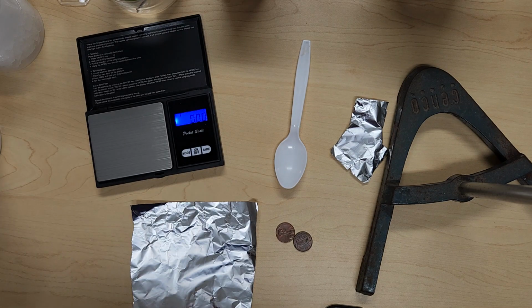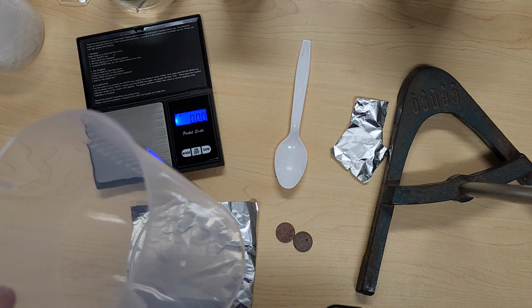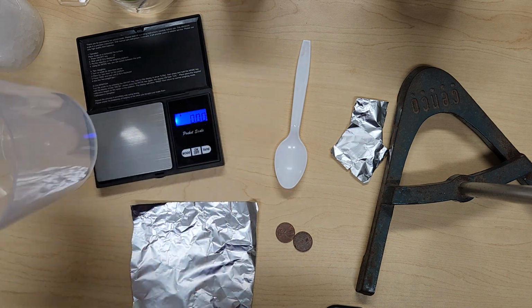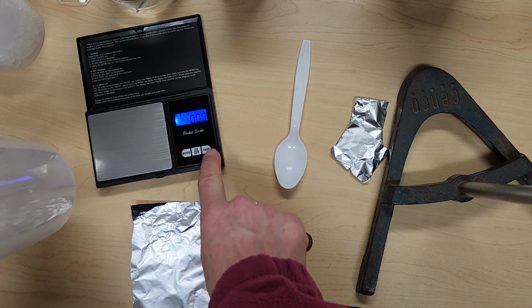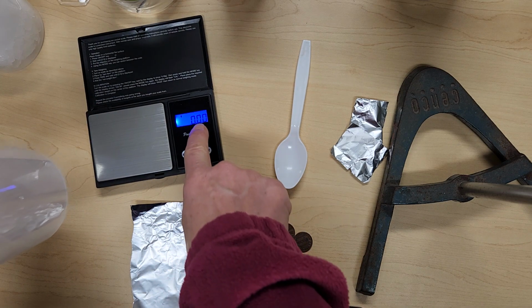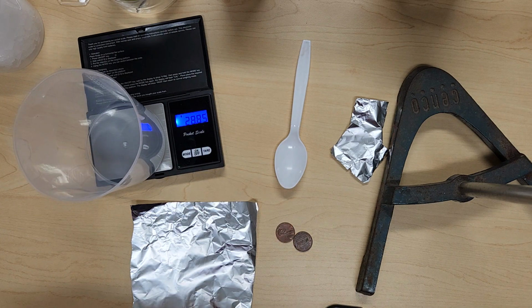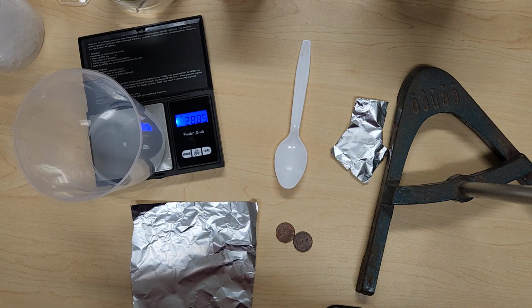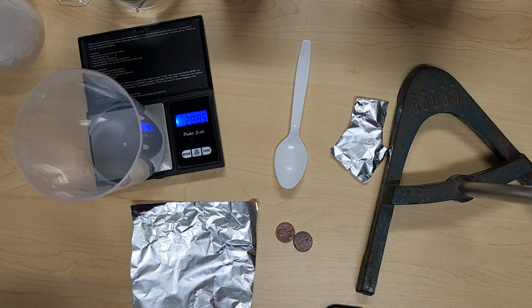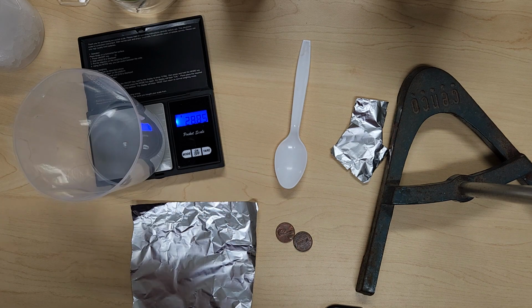Okay, the very first thing we're going to do is look at vinegar and baking soda. So we're going to take a beaker, and make sure your balance is tared and says 0. If not, you can use the tare button so that it says 0 before you start. You can put your beaker on, and now this tells us the mass of the beaker, but we're not very concerned with that mass, so we only care about the stuff that we're putting inside of it.